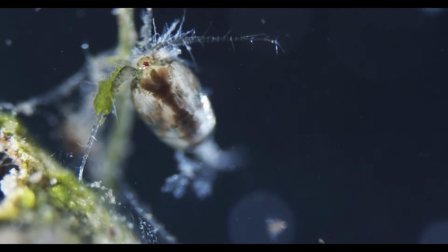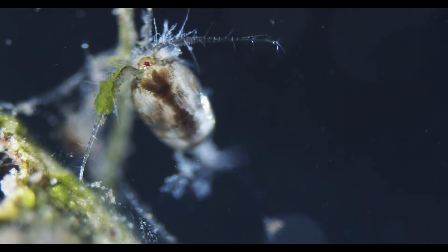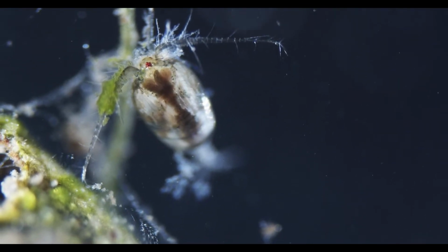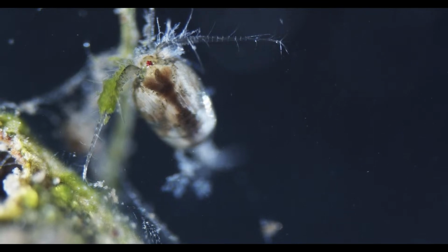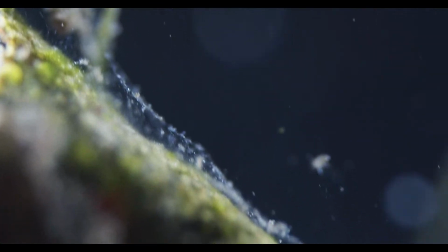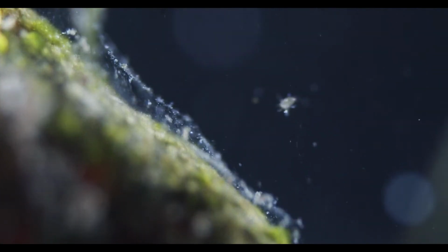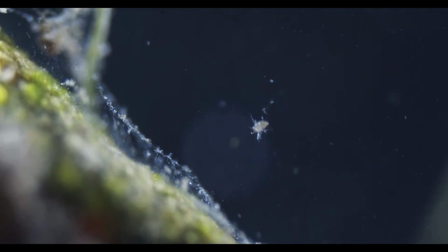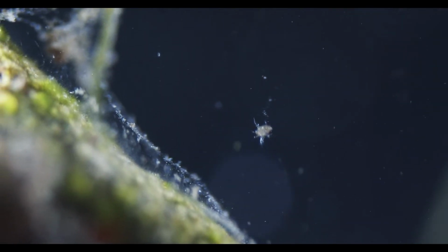And isopods and amphipods have a marsupial pouch for breeding, and their young are only released when they are like miniature versions of the parents, basically. So any small crustacean larvae like this should be a copepod, as far as I know.